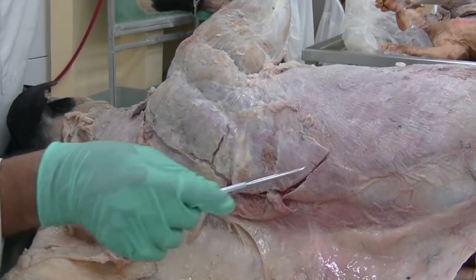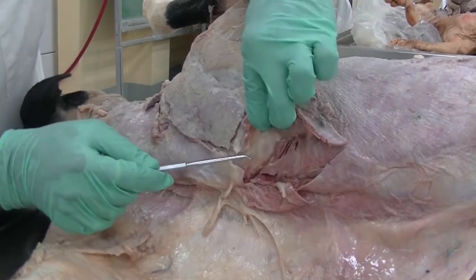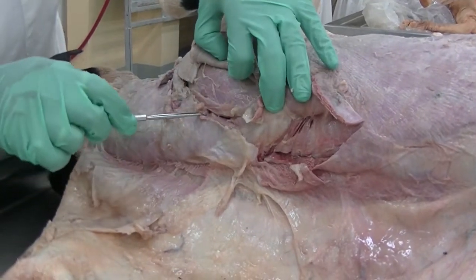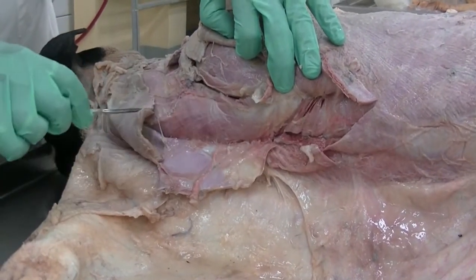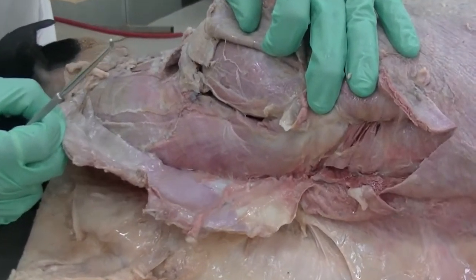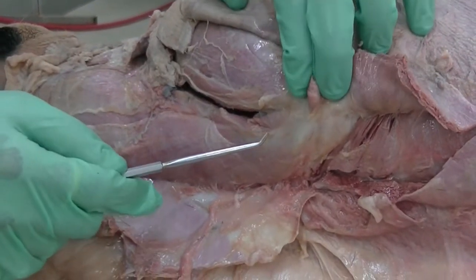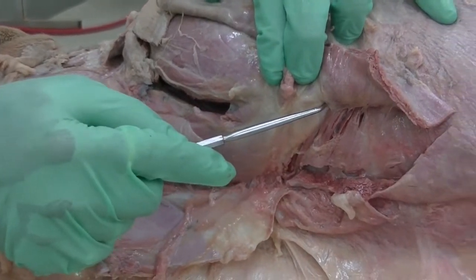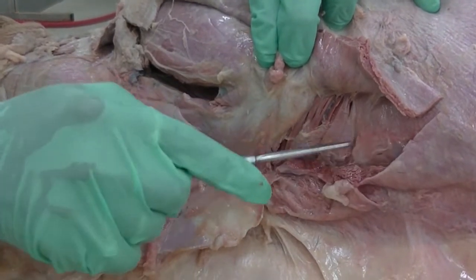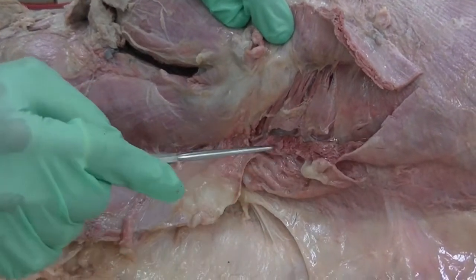Here we transect the trapezius, the cervical and the thoracic portion, reflected laterally, as well as along towards the dorsal midline, also reflecting the cut portion of the cleidocervicalis in order to expose another extrinsic muscle of the forelimb, which is attached to the dorsal border of the scapula on its medial side. Part of the muscle which is attached to the thoracic region, we see the cut portion of the trapezius.